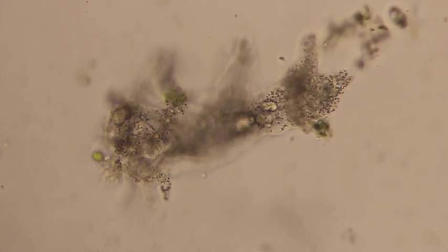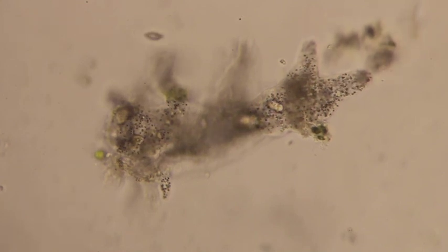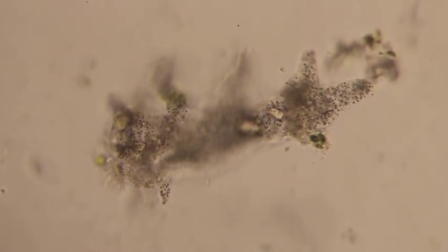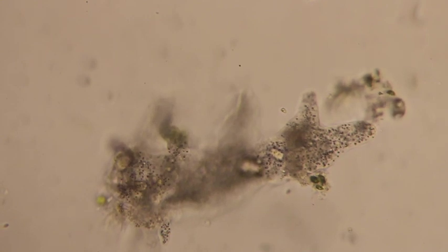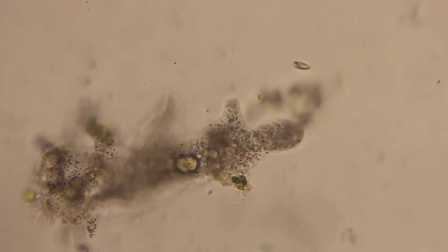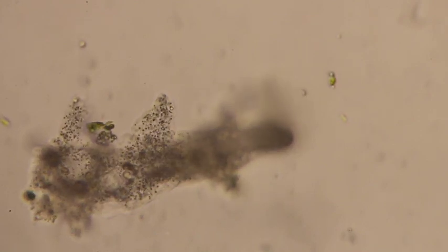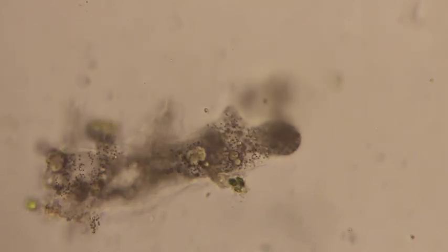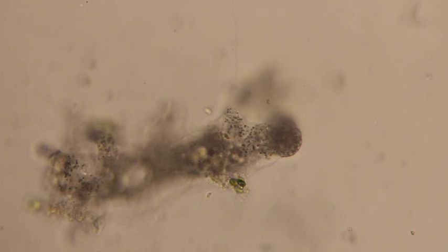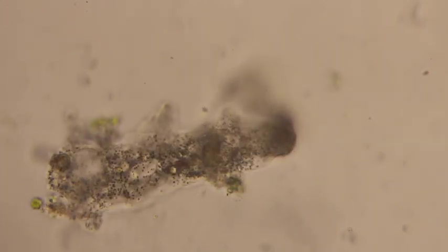Some interesting questions I always have about an amoeba: what makes it go the direction that it goes? We can see this amoeba is just moving along, moving forward from left to right. I really don't know what clues or chemical signals it uses to figure out where to move, but they definitely have certain personalities and will move in various directions.